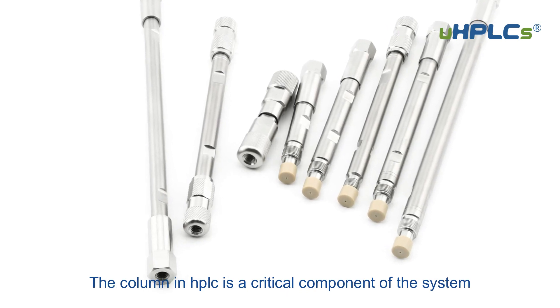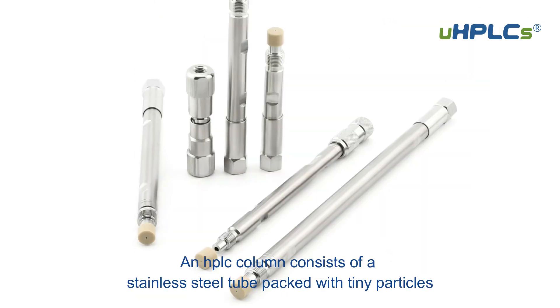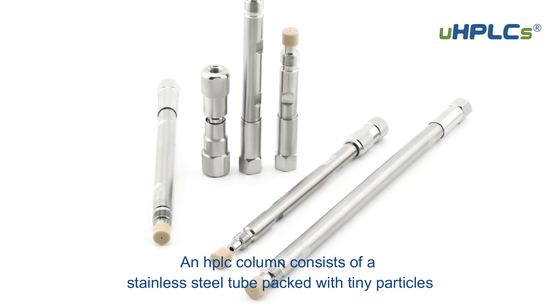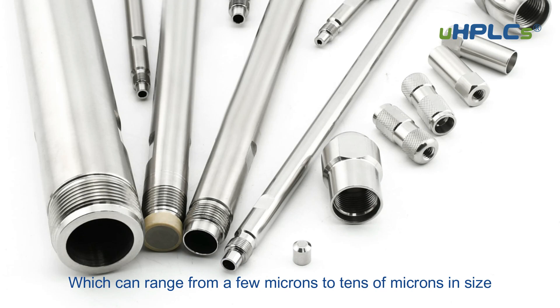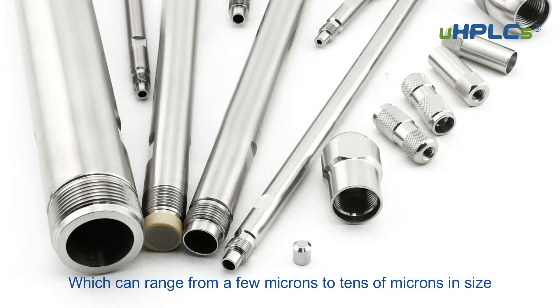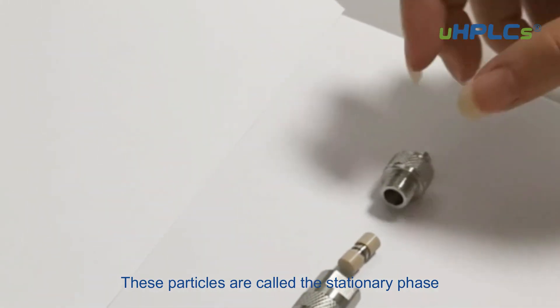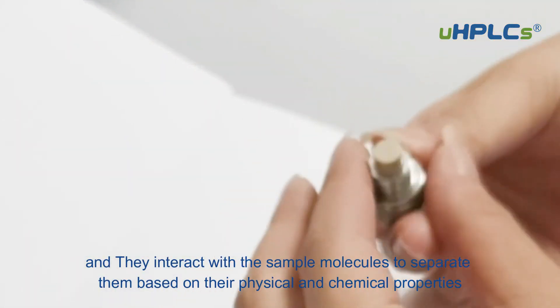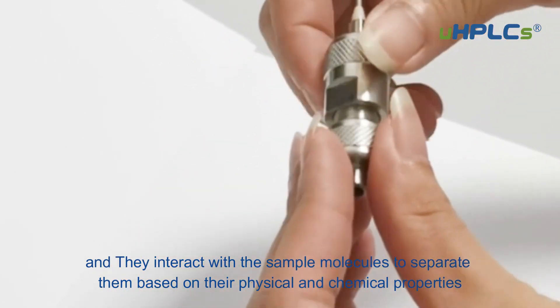The column in HPLC is a critical component of the system. An HPLC column consists of a stainless steel tube packed with tiny particles, which can range from a few microns to tens of microns in size. These particles are called the stationary phase, and they interact with the sample molecules to separate them based on their physical and chemical properties.